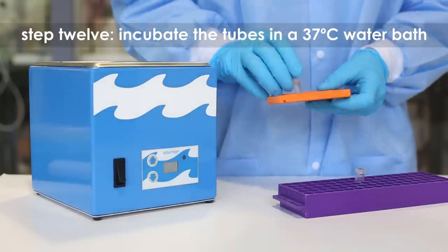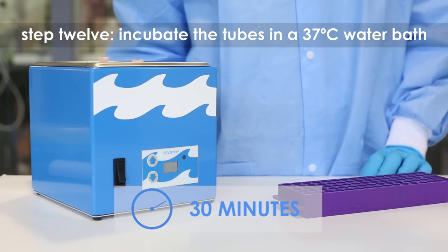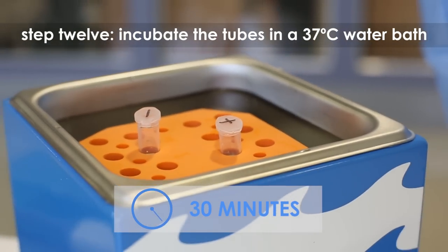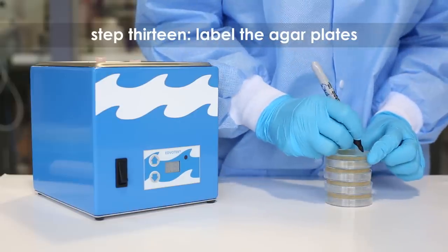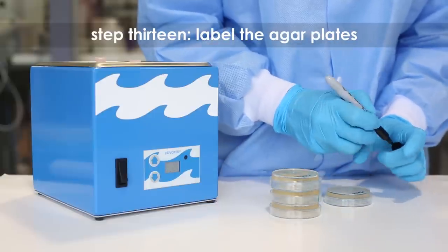Step twelve: incubate the cells for 30 minutes in a 37 degrees Celsius water bath. Step thirteen: while the cells are recovering, label the bottom of agar plates as indicated in your protocol.